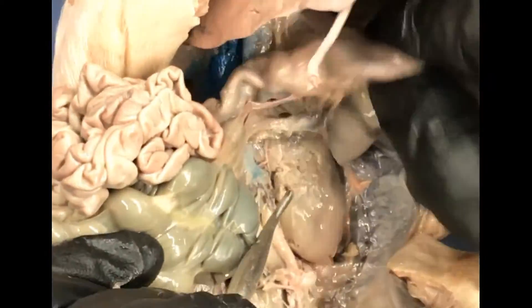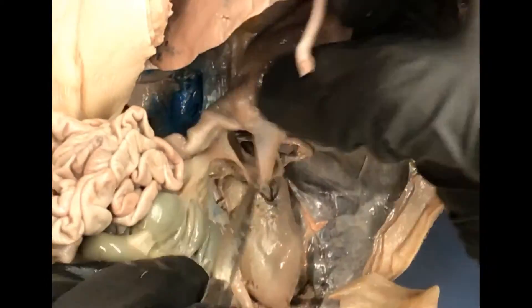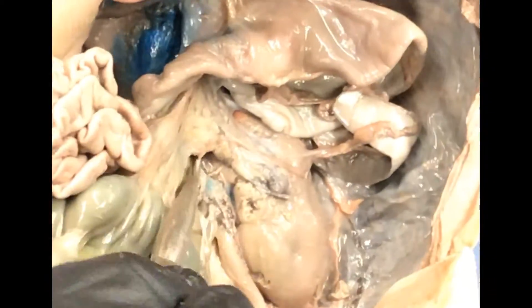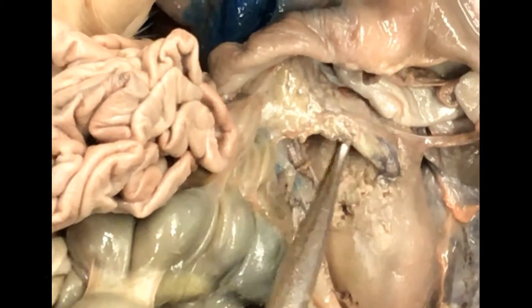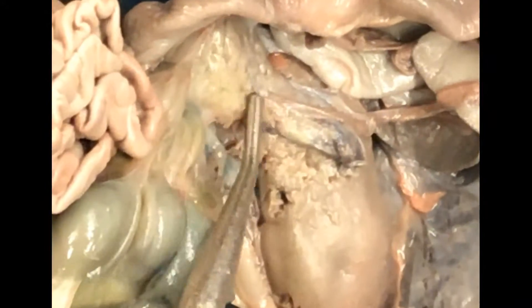These arteries are the umbilical arteries again. The only thing we didn't see yet is right here. When you pull the stomach aside — retroperitoneal — you'll see a very granular organ. Its head is tucked inside the C-shaped concavity of the duodenum, and its tail heads out toward the spleen. This is the pancreas, right there.